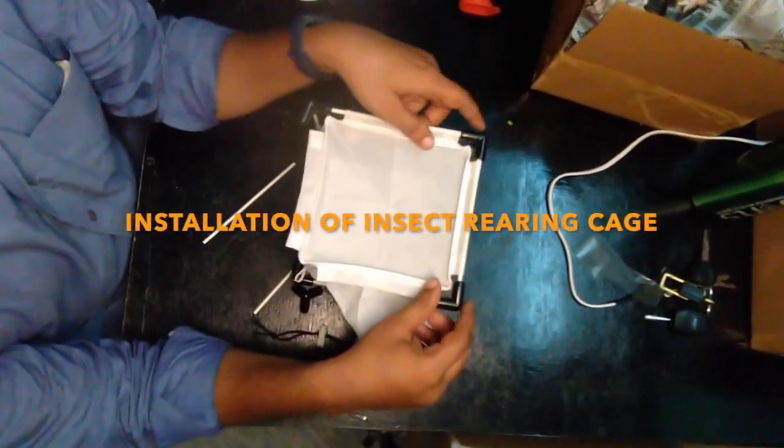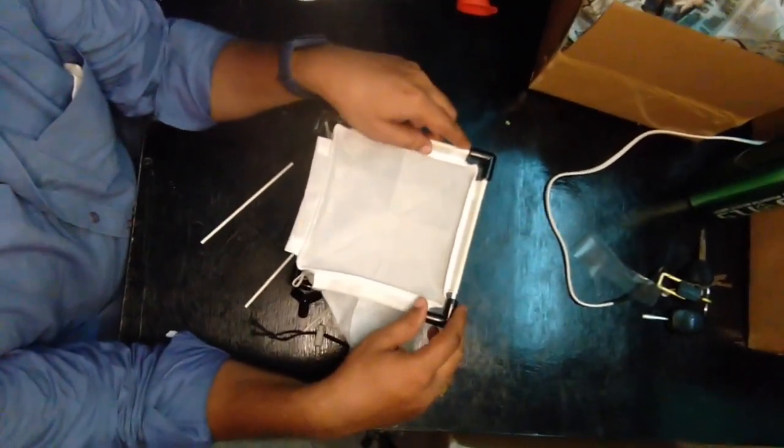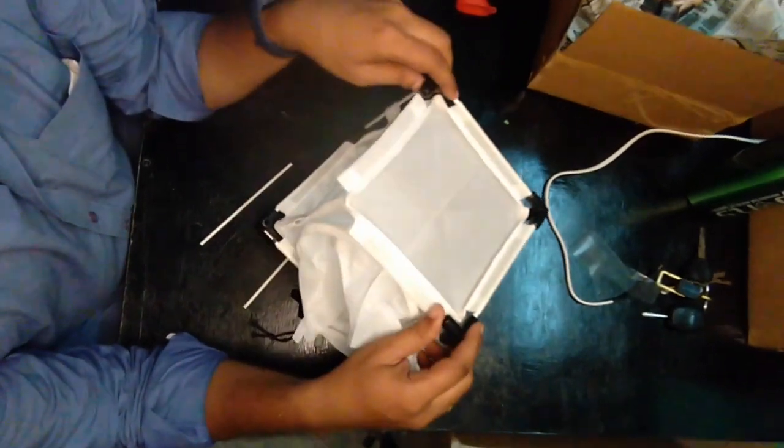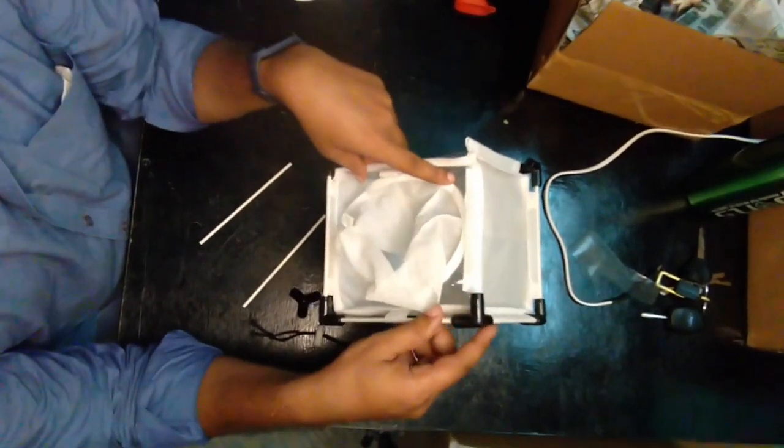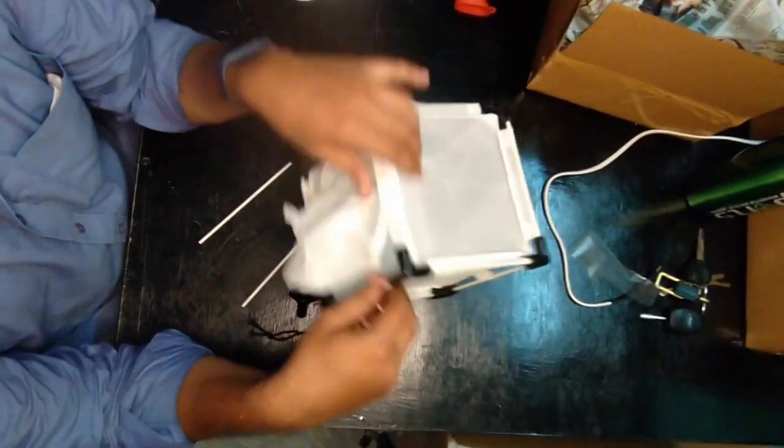Hello guys, I'll demonstrate how to install the insect cages. I have installed this cage partially. We need to take different types of cages.